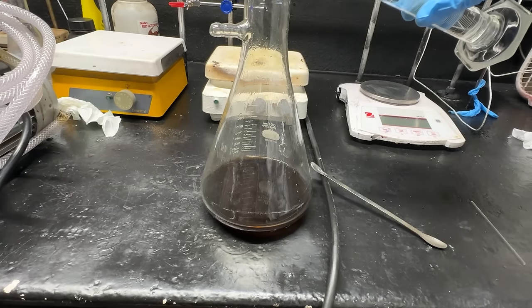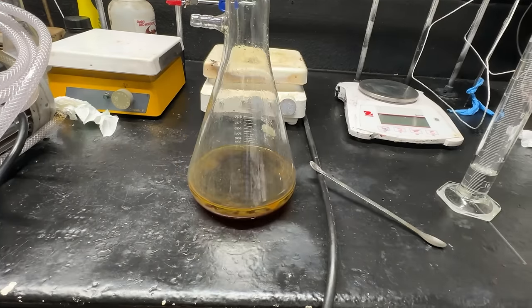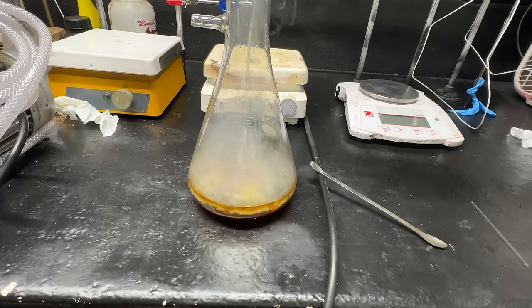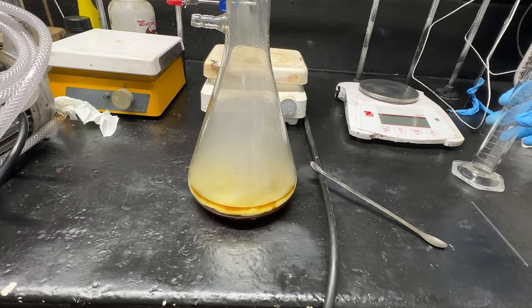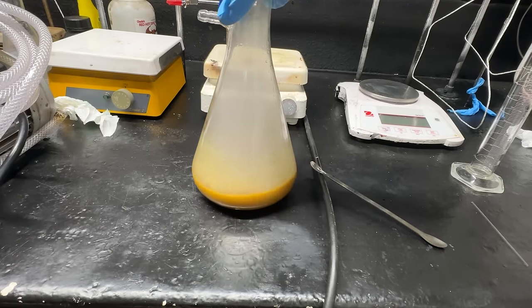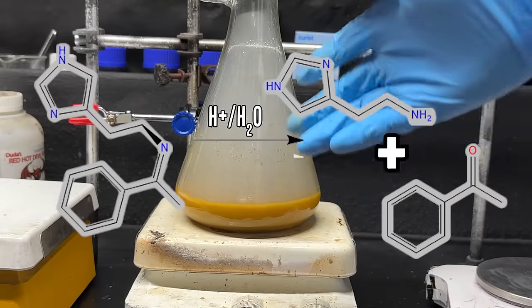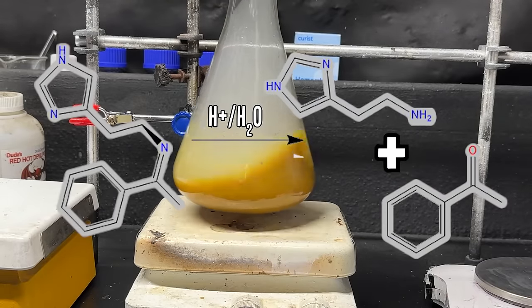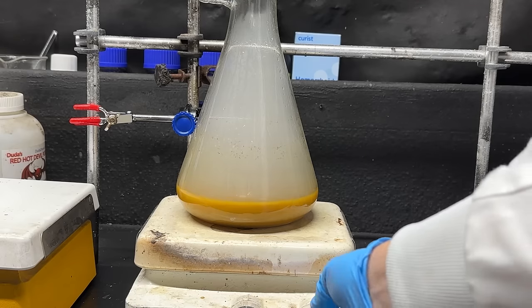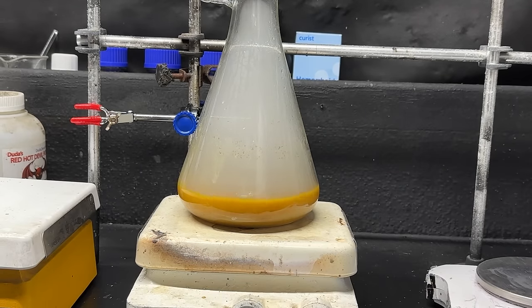The first thing I'm going to do is add 20 milliliters of distilled water and give that a good swirl. Now I'm going to add 20 milliliters of 31% hydrochloric acid — this should form the hydrochloride salt of our imine, and you can see it does form a quite nasty-looking emulsion. Then I'm going to move this to heat. Our goal now is to do the hydrolysis step where the acid will cause the imine to fall apart, forming our histamine and our acetophenone. I'll let that react for about 30 minutes.